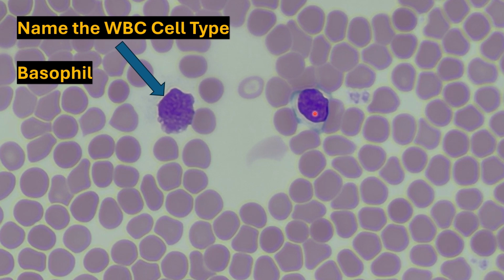The lymphocyte has a single round nucleus, and that nucleus is about the same size as a red blood cell. But we can also see that there's a clear ring on this side as well as the other side that can be described as a ring or a halo. We see that because there are no granules, the stain of the basic dark purple nucleus here is easy to distinguish, and the cytoplasm, because there are no granules, appears clear.